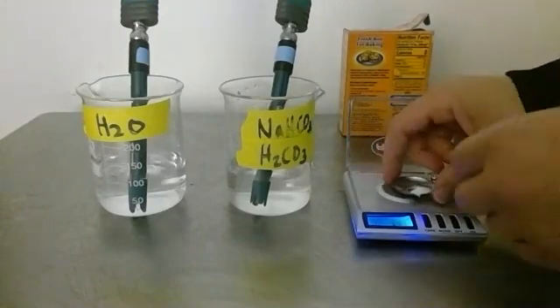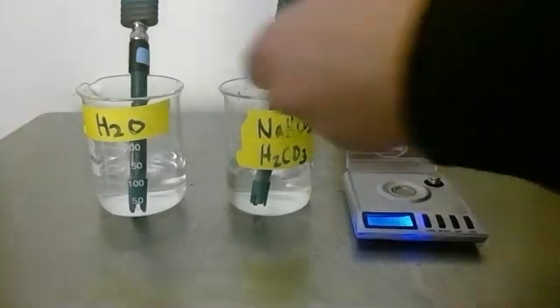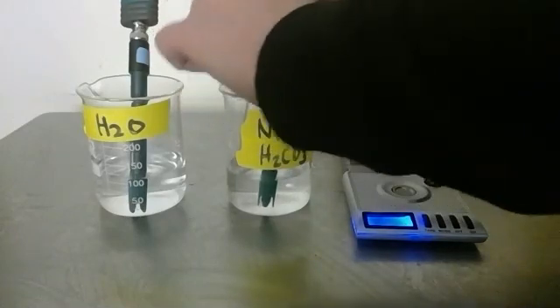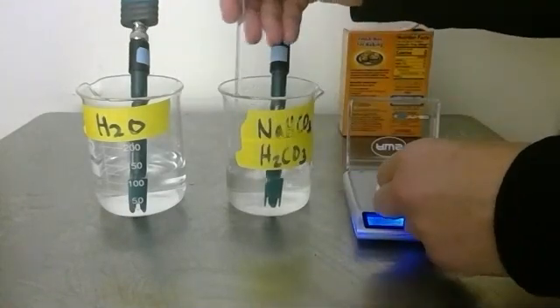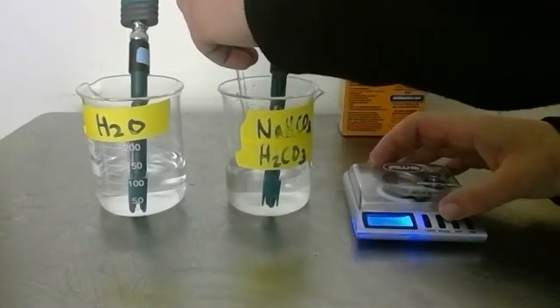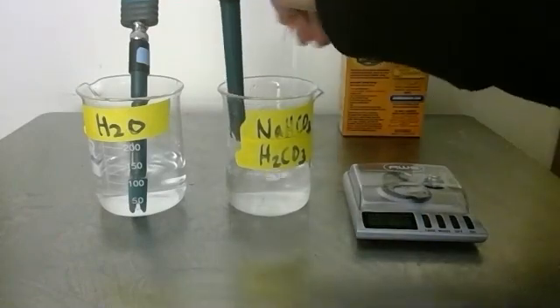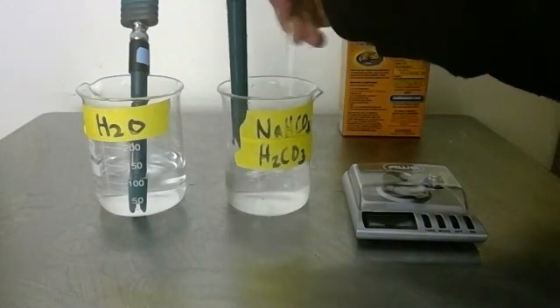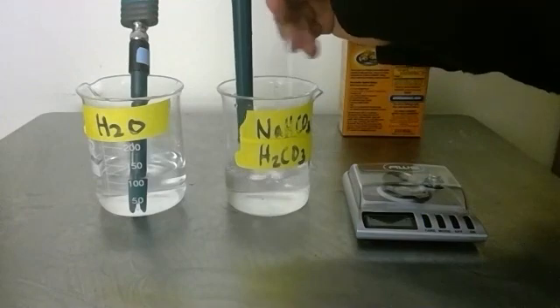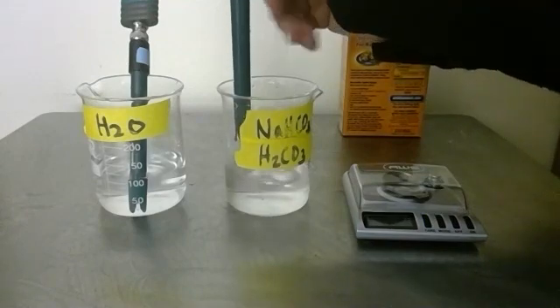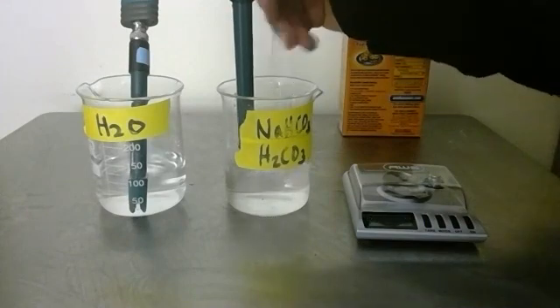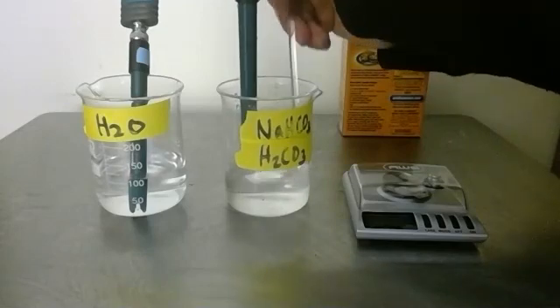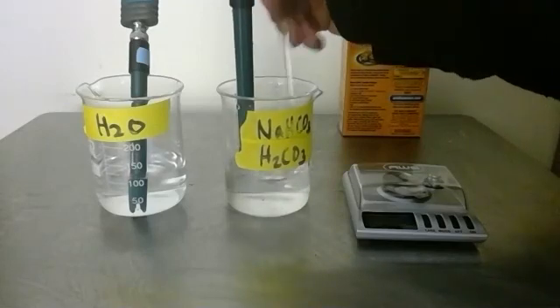I'm going to dump it in and use a stirring rod to stir it vigorously until that white powder, the sodium bicarbonate, dissolves. I've basically added the conjugate weak base to that weak acid, carbonic acid, that I made by blowing CO2 into the water. The CO2 dissolves in the water, then reacts with it in a reversible reaction to form carbonic acid.